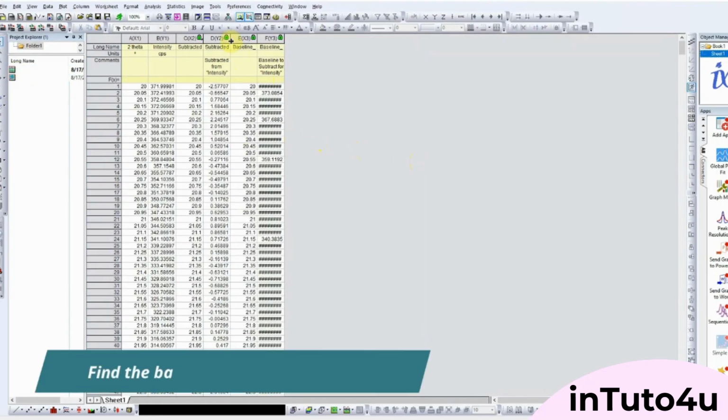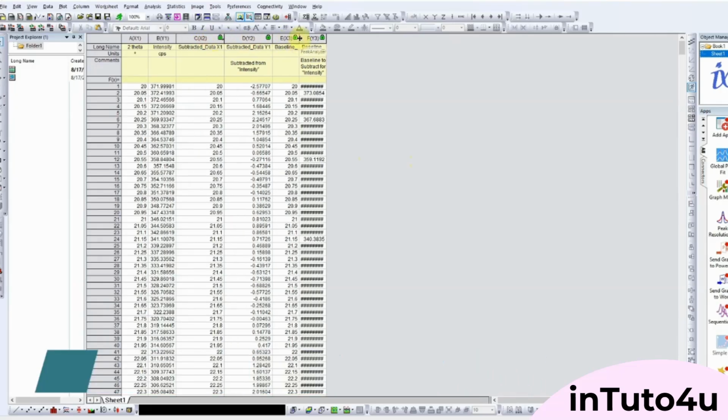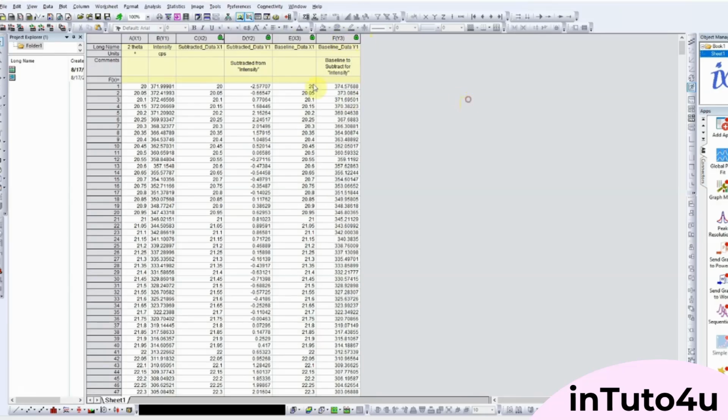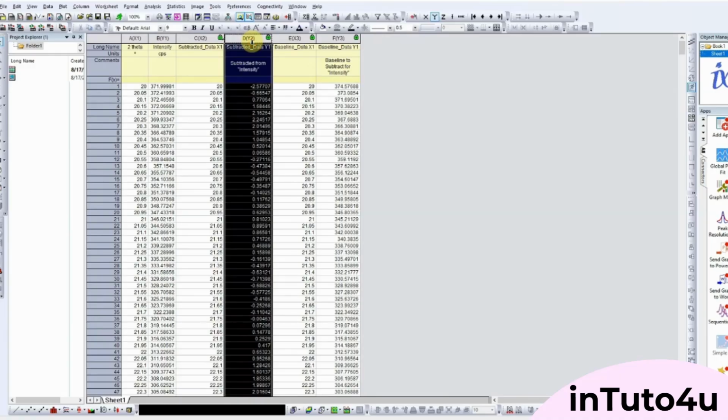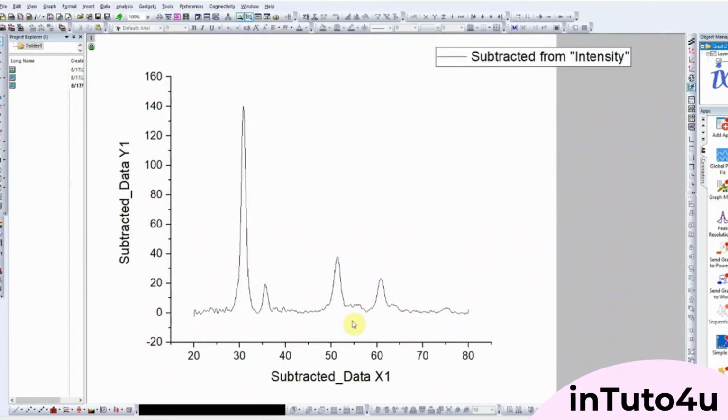See the difference? On the left, peaks sit on a messy slope. On the right, after correction, they're sharp and accurate, ready for reliable analysis. A few quick tips. Always correct the baseline before peak integration. Don't overcorrect, or you might erase real signals. And always save both raw and corrected data for transparency.